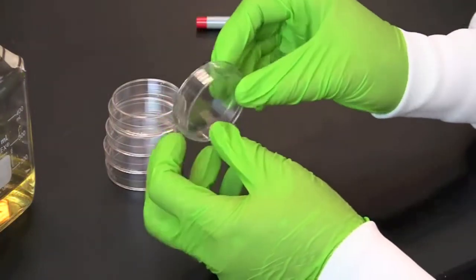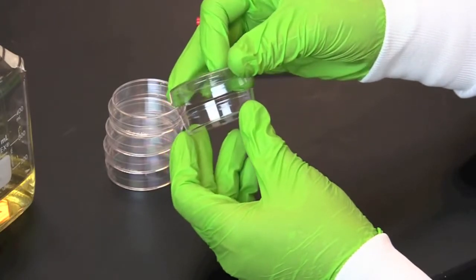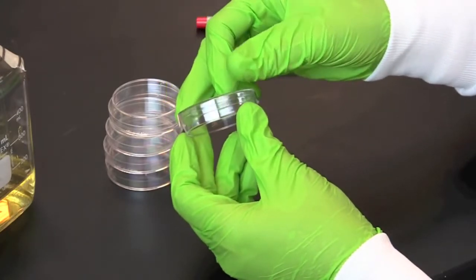We will be pouring our media into petri dishes. Petri dishes have a base and a lid. The lid has a slightly larger diameter and fits over the base.